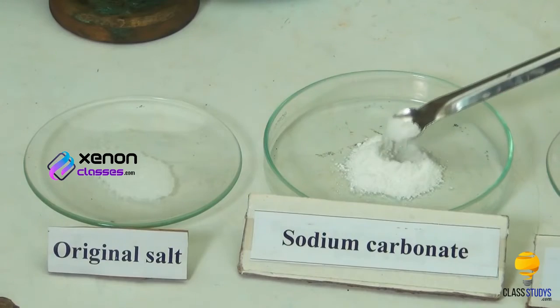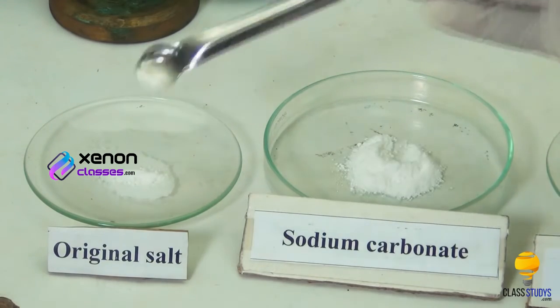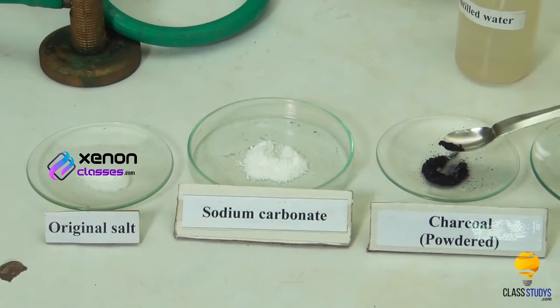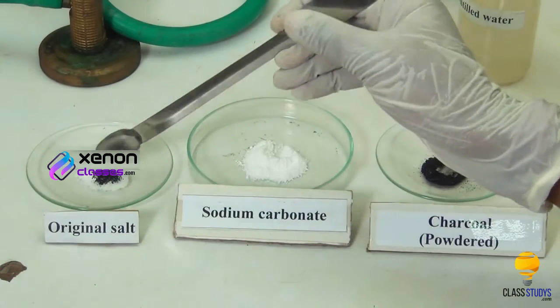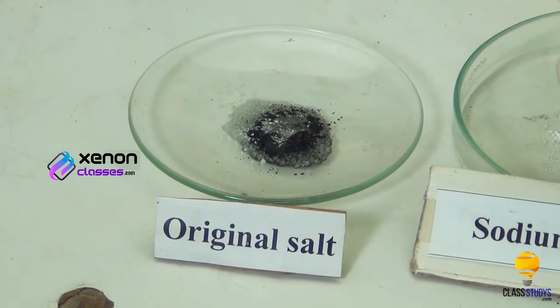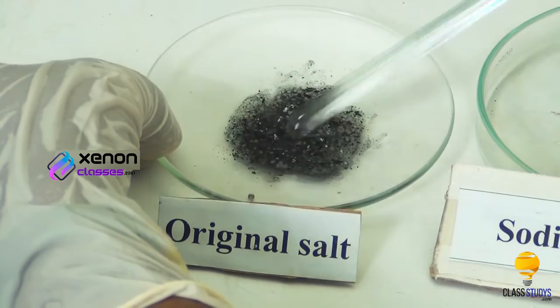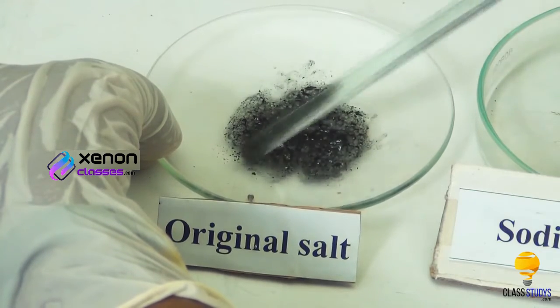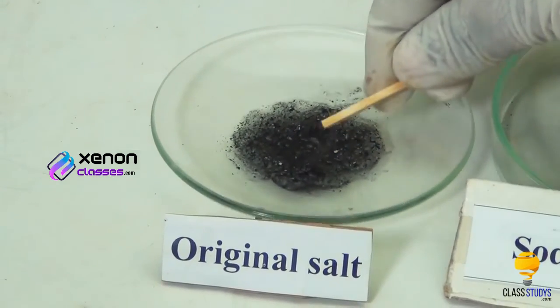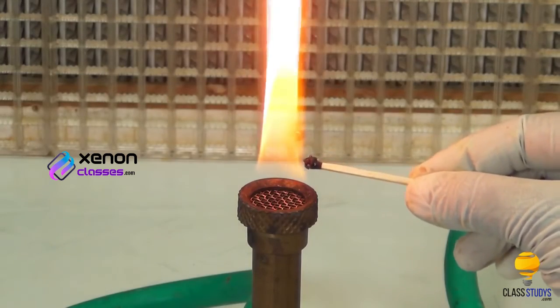To this, add a small amount of solid sodium carbonate using a spatula. Then, add a little powdered charcoal using another spatula. Now, add a few drops of distilled water to the mixture. Mix the contents of the watch glass with a glass rod so as to get a paste. Take some of this paste on one end of a wooden splinter and heat in the reducing flame of the Bunsen burner.